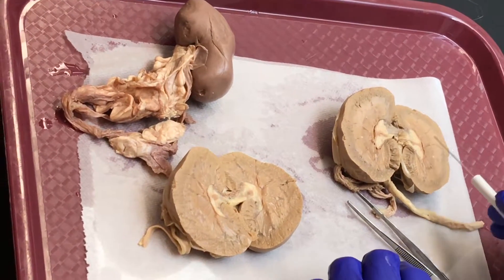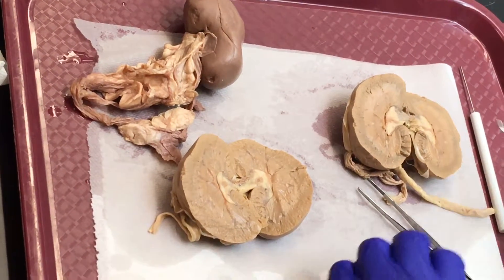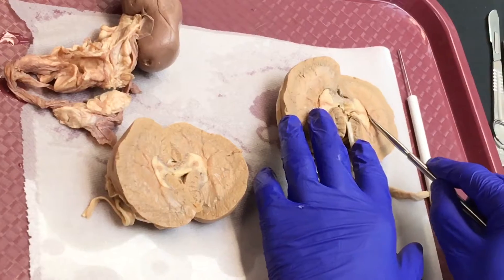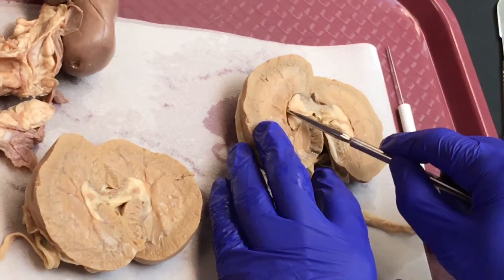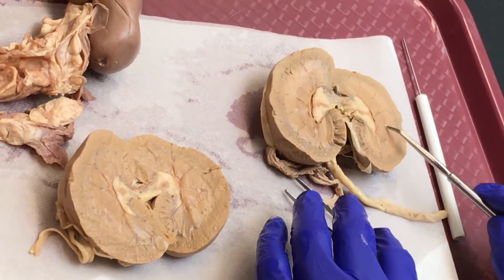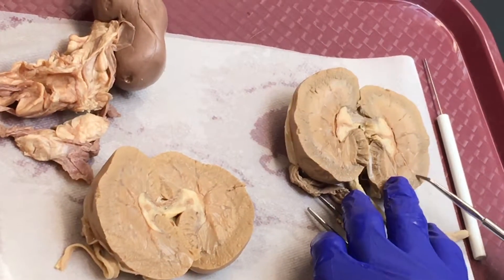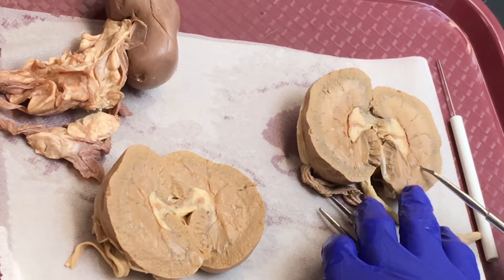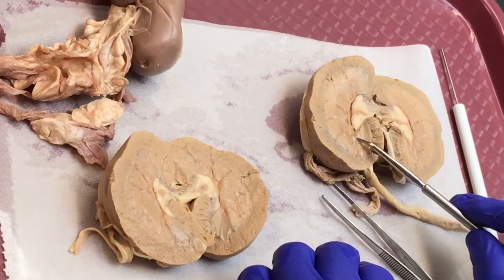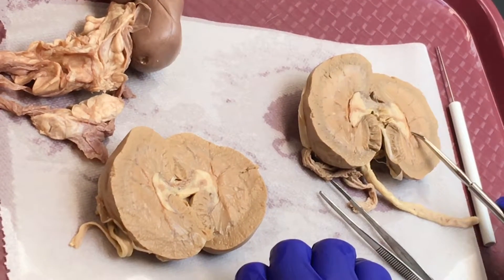The renal pelvis is located within a space called the renal sinus. I think this is a good demonstration here — the renal sinus. These are renal pyramids. In between the renal pyramids, you can see cortical tissue called renal columns.